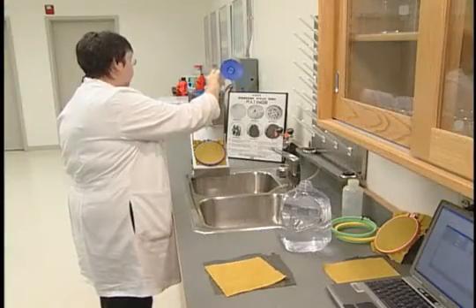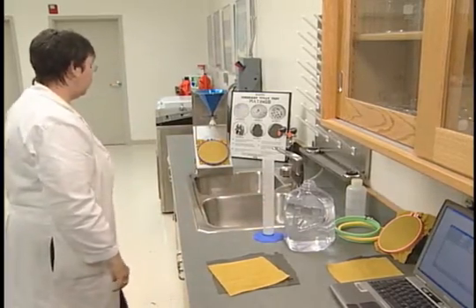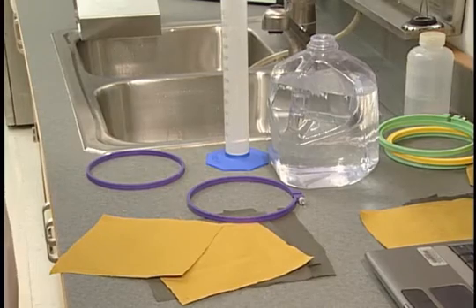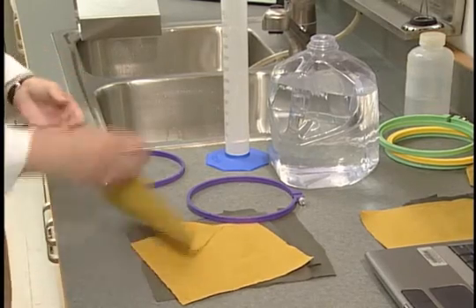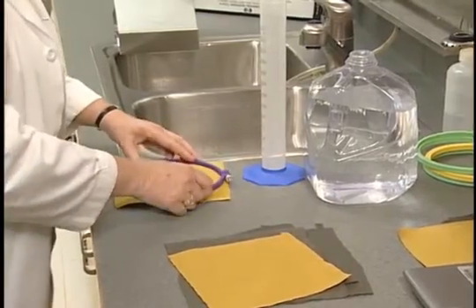This test method was developed in the early 1940s to measure the efficacy of water repellent finishes. The procedure calls for a test specimen 180 by 180 millimeters to be inserted into a 152 millimeter diameter embroidery hoop so that the surface or face of the fabric is taut across the spanned area.